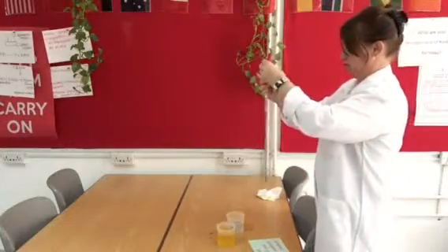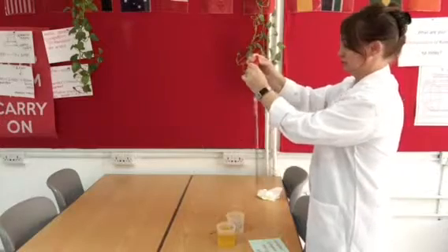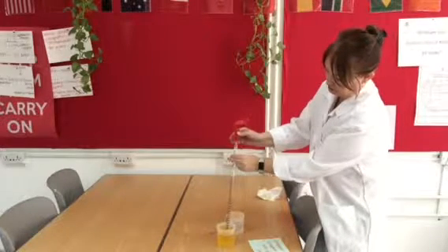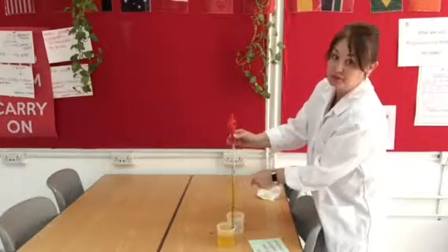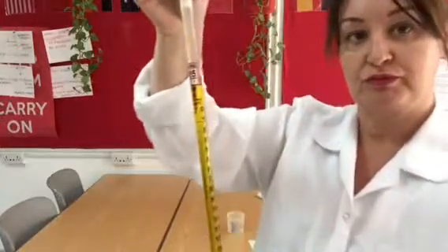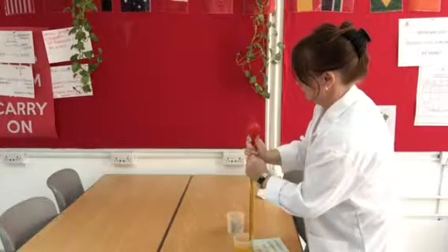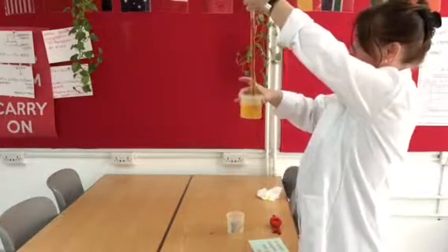Okay, so I'm going to press the valve at the top labelled A, give it a squeeze, push all the air out, there it goes, and then I'm going to place it in the liquid, and then I'm going to press the valve labelled S for suck, and as I do that you can see that the liquid rises up inside the pipette. And there you can see I've gone beyond 0. So now what I need to do is very carefully let some of that liquid out. The easiest way to do this is to remove the ball pump, keep the other end submerged in the liquid, and just use the pressure of my thumb to slowly release.